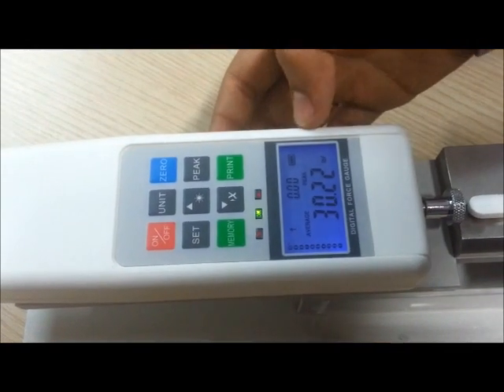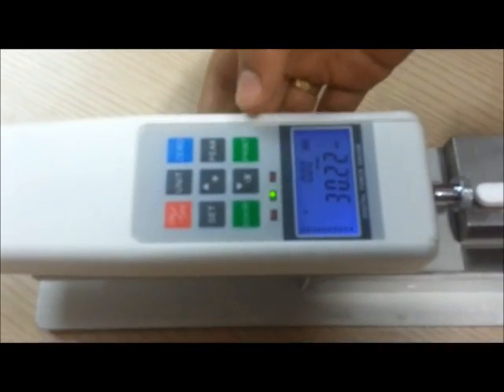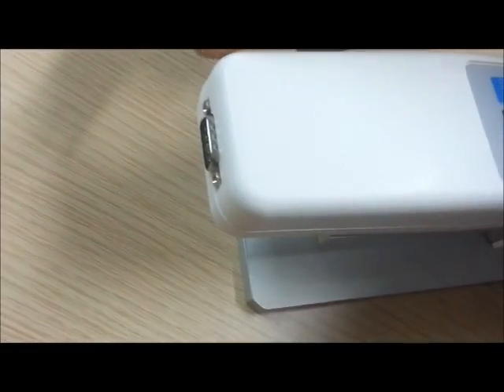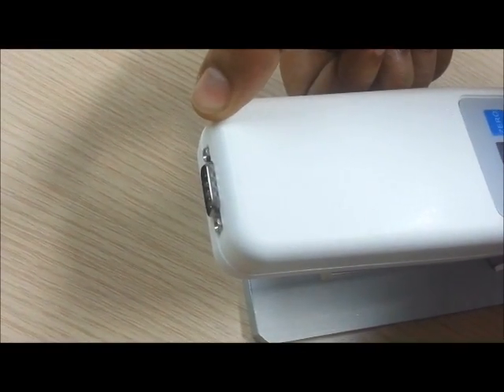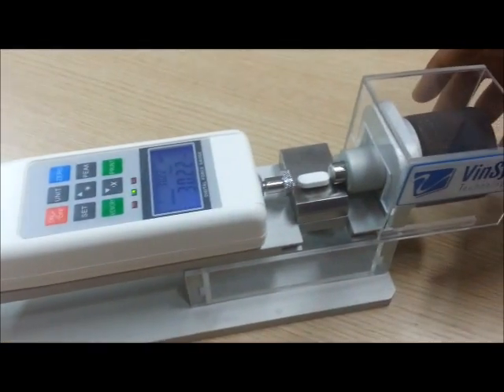You may also save the data with the press of the memory button. You may also take a quick printout of the data. Or you can connect a computer to the RS232 interface provided with the instrument and take the data on your PC with ease.